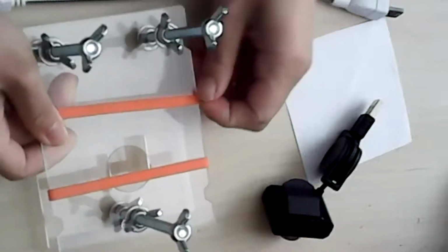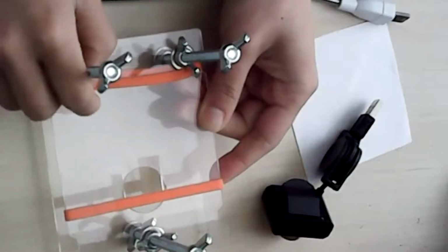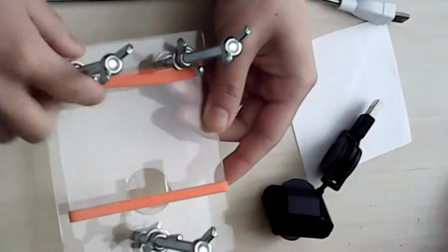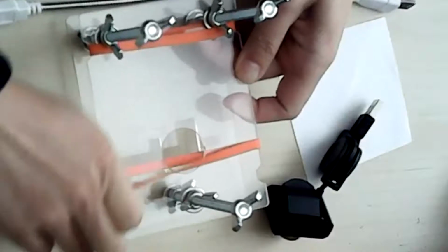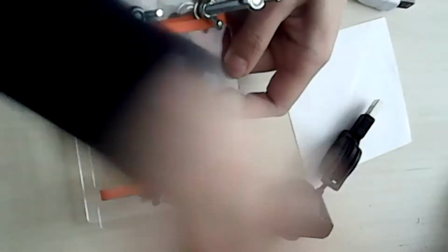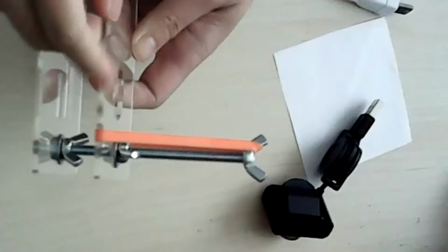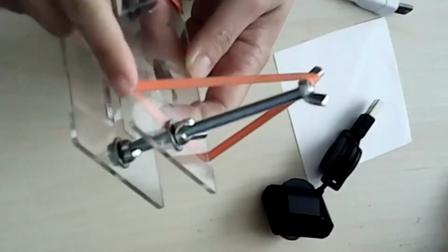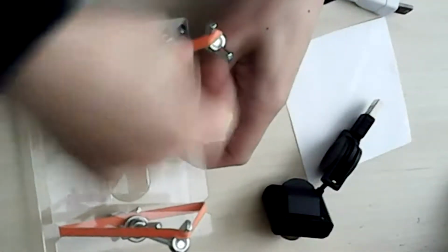And yeah, so now you can put these in the grooves. The reason I don't put them in the grooves at the beginning is because it makes it a little bit hard to screw in the bottom wing nuts, because essentially they're taking up the same space, the wing nut and the rubber band. And so now that your wing nut is screwed in, you can put the rubber band here and lift it up so that it hooks onto this top wing nut. This is how you keep your microscope in the configuration that you want it to be in.